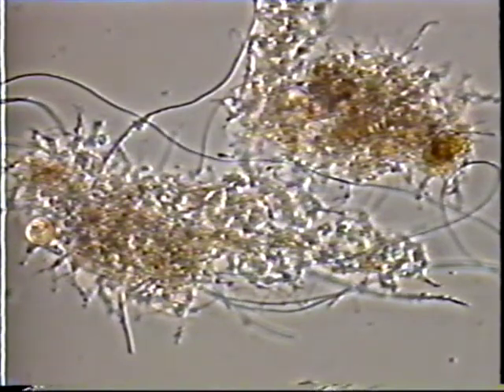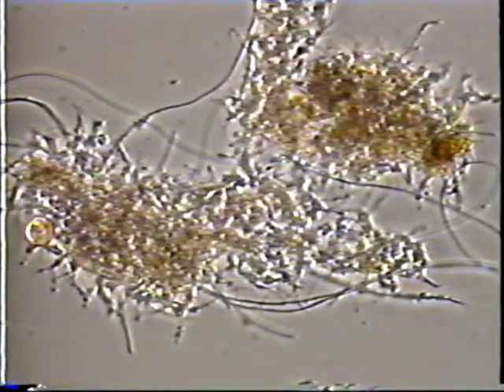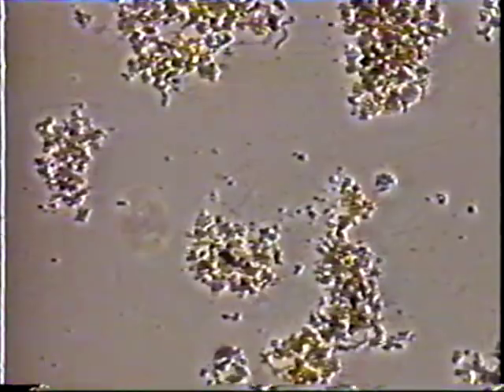Type 1701 causes a different type of bulking than Sphaerotilus. Type 1701 grows mostly within the floc and causes an open and diffuse floc structure. It has sausage-shaped cells and a well-defined sheath. Note that this is a thinner filament with a diameter less than 1 micrometer. Type 1701 is Gram negative and Neisser negative.